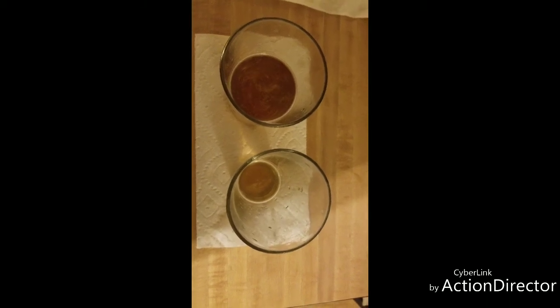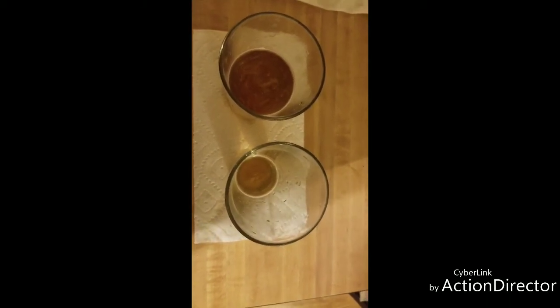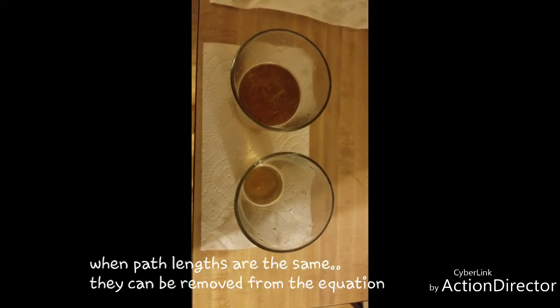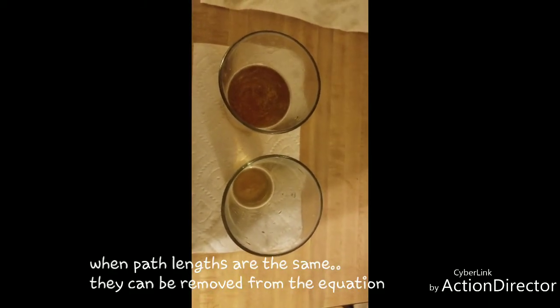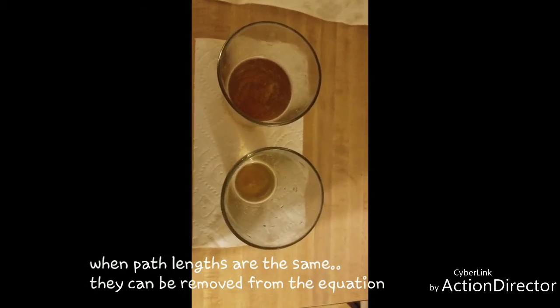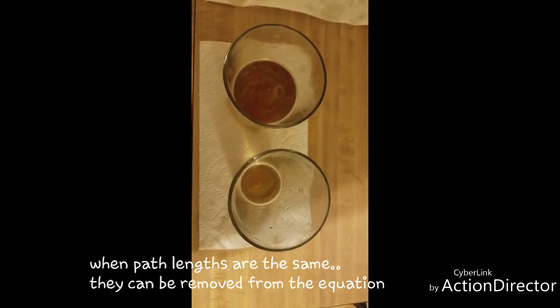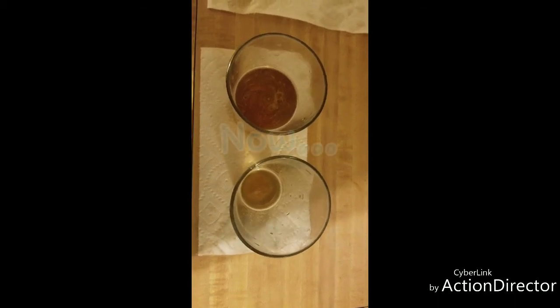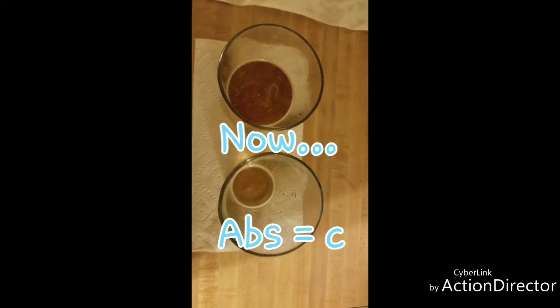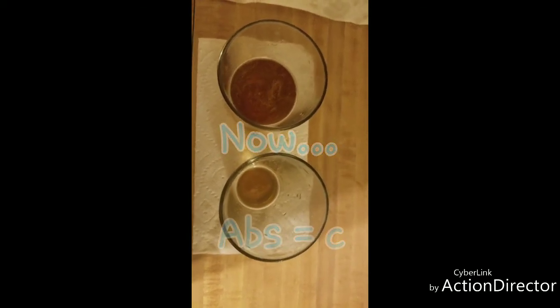What we can do in this instrument is keep the path length and the molar absorptivity constant by using the same beer really in this experiment, and by using one of these cuvettes that I'm going to show you, and then we could just determine the absorbance solely on the concentration alone.